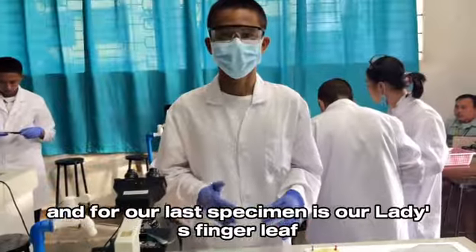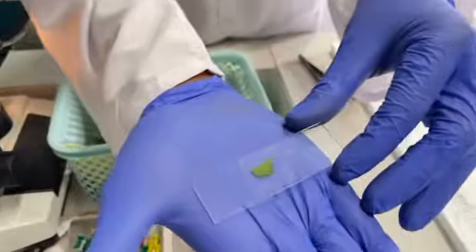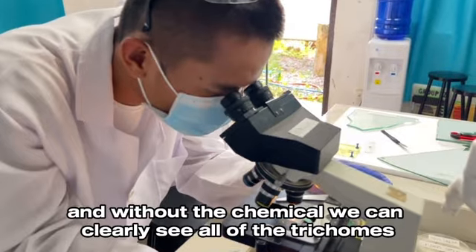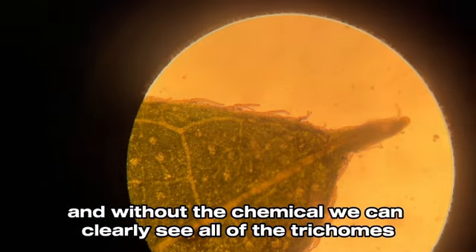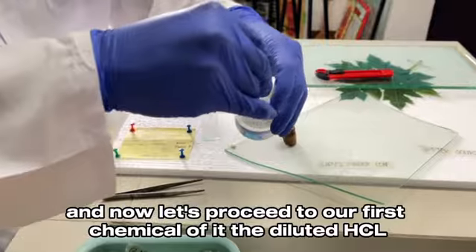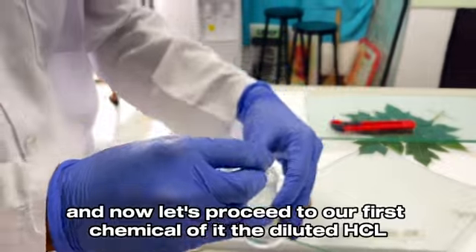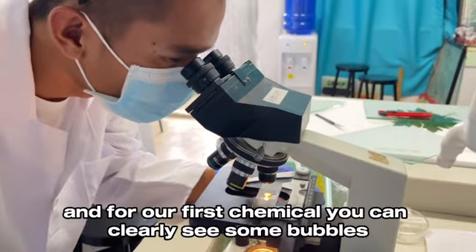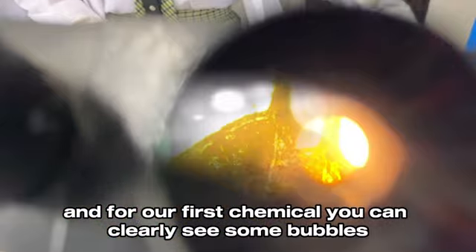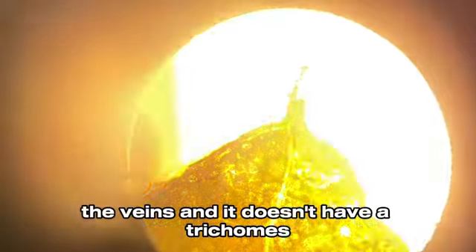And for our last specimen, the lady's finger leaf. Without the chemical, we can clearly see all of the trichomes. Now let's proceed to our first chemical, the diluted HCl. With this chemical, you can clearly see some bubbles and the veins, and it doesn't have trichomes.